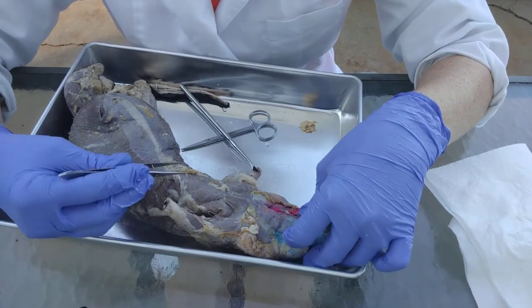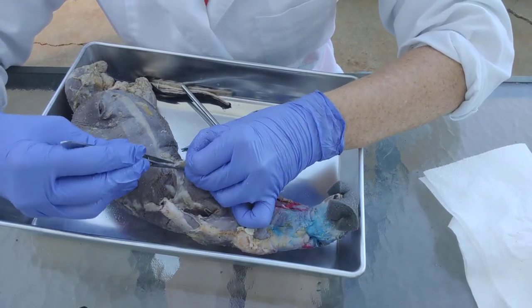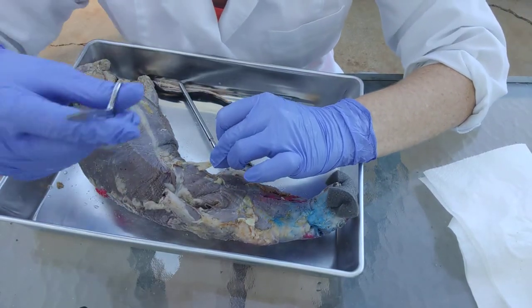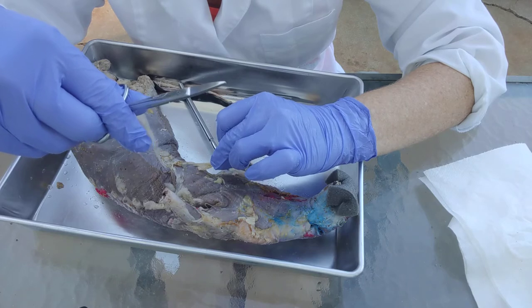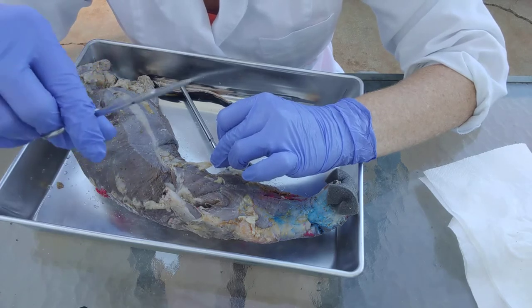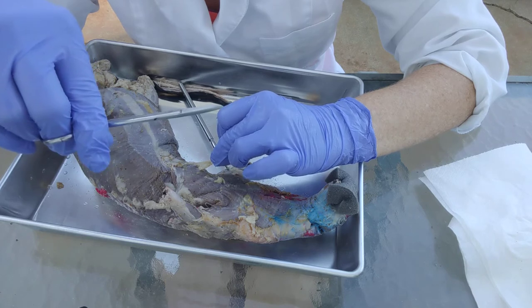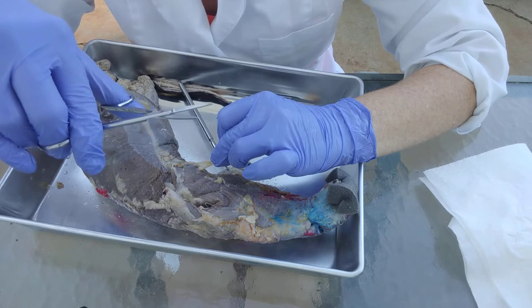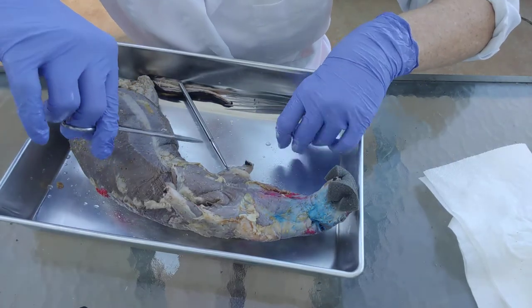When you're pulling on it, you want to pull up on the fat tissue — it's really soft so it should come off fairly easily. The fine scissors have a really sharp point, and I'm not going to be using them to cut anything. I'm going to use them to do what I call 'stick and spread': stick into the fat tissue right above the muscle — don't poke the muscle itself — then open them up to spread things off the tissue, and snip off the extra as it comes up.